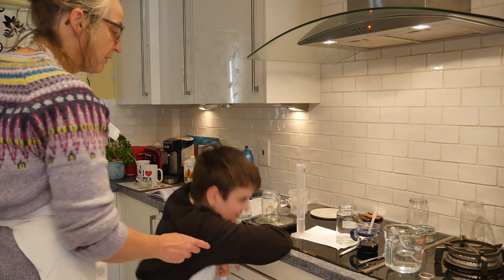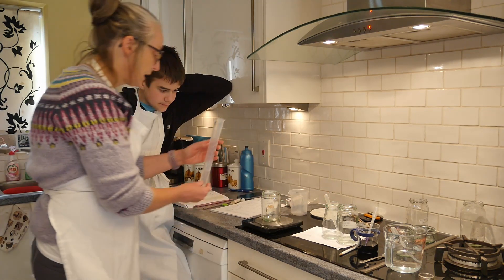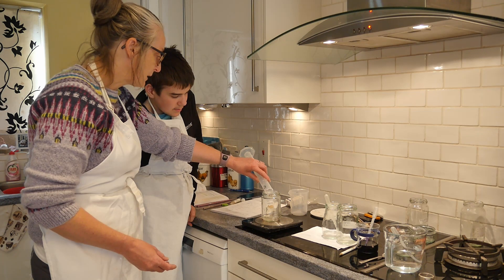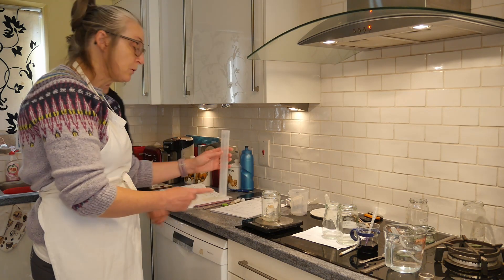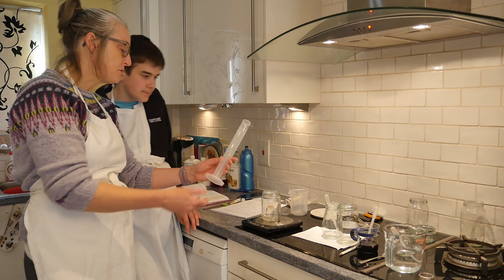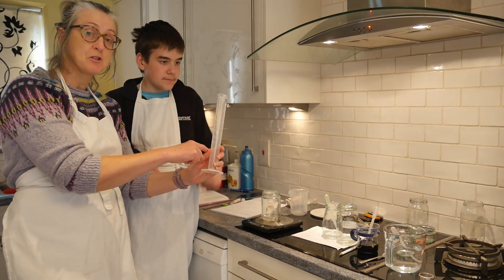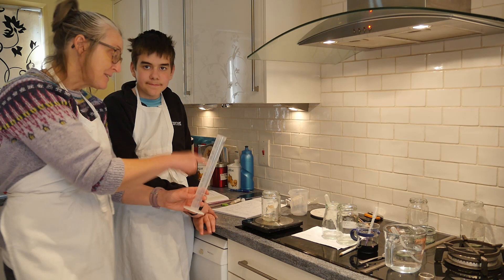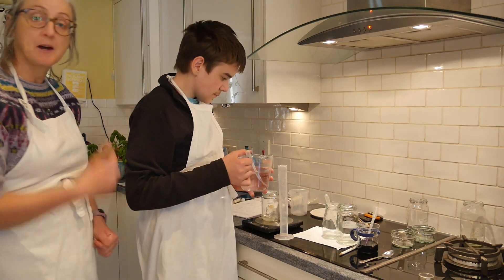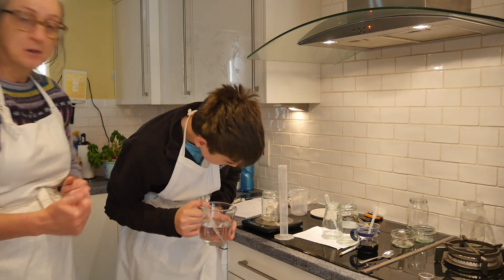You've got the 25 millilitres from that accurately. We'll leave that pipette in there so we know which one it was. Now we're pouring out clean fresh water — we'll call it distilled, it's softened using reverse osmosis. We measure out 25 millilitres of water; we don't need to wash the measuring cylinder out first because it's the same concentration of solution as before, and rinsing it gets the last bits in.